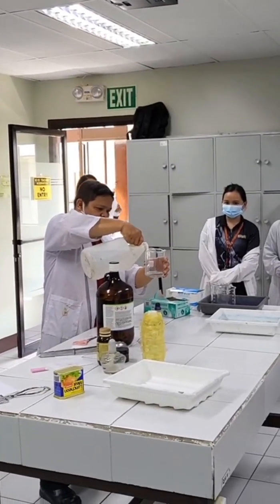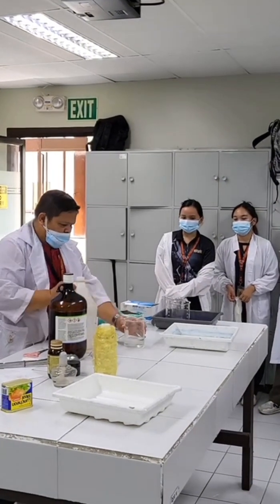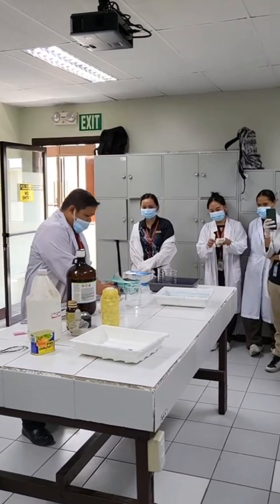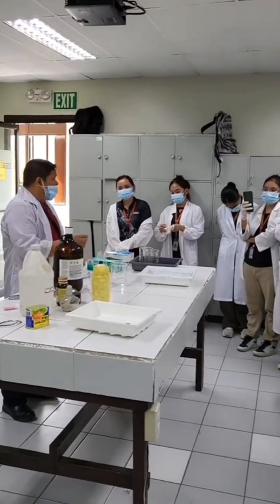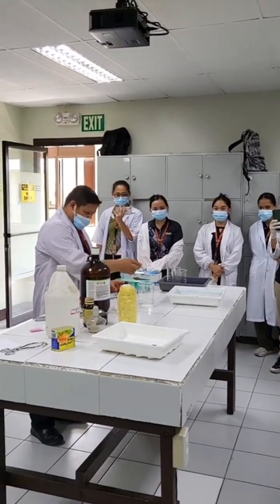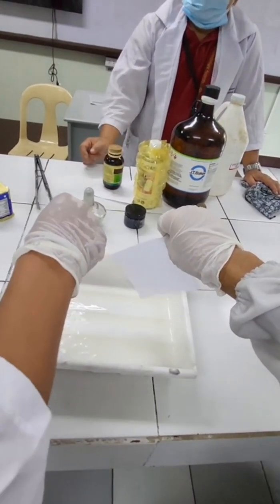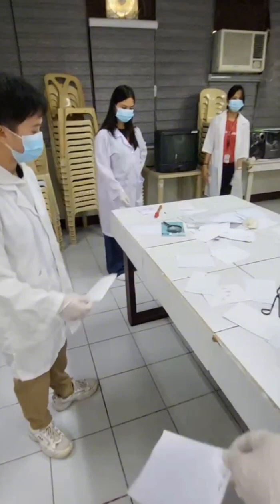And this is the moment when measuring starts. And now, it is our turn to use the chemicals for developing our fingerprints. You just need to dip it for a while back to back and then wait for a moment and let it dry until the fingerprint appears. And this is us waiting for the fingerprint to appear.